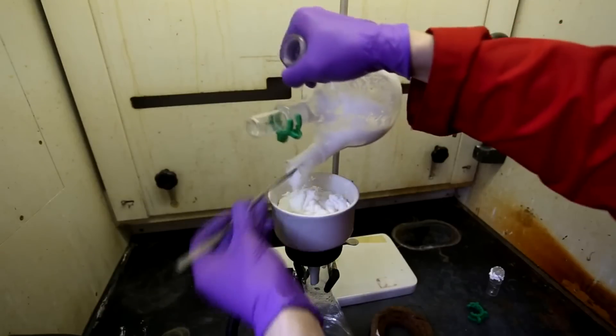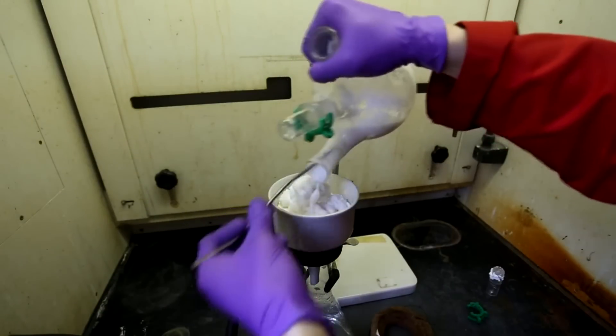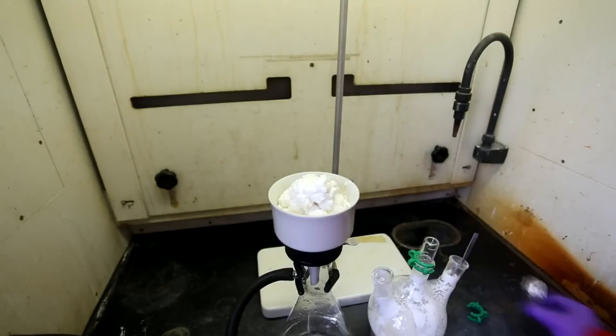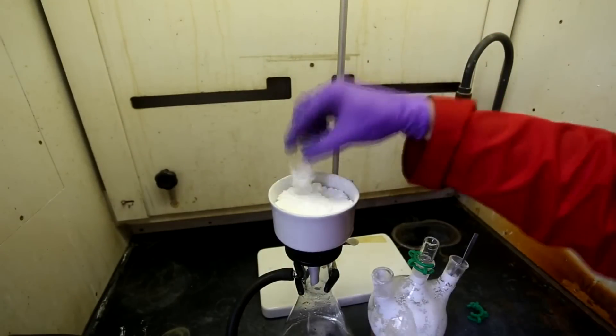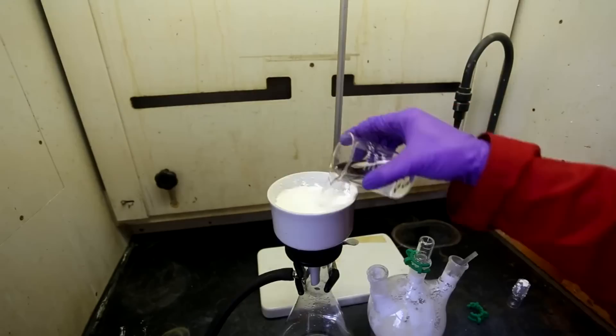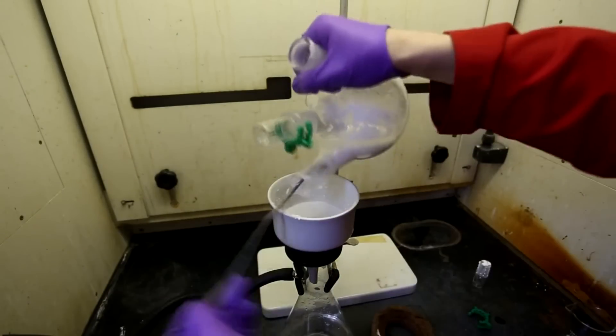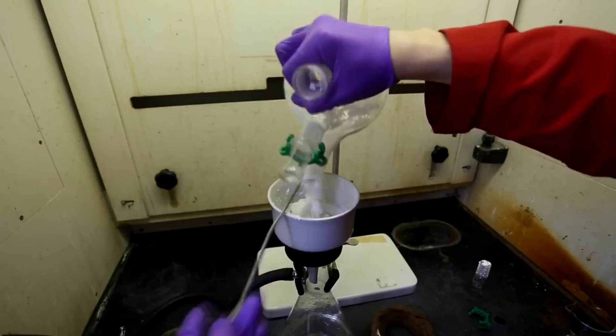However, I don't think this was nearly enough and I highly suggest washing with a lot more water, say like 300 milliliters or even more. It is important to wash with a lot of water because you want to remove as much hydrochloric acid, as much salt, and as much acetic acid as possible. Salicylic acid is almost insoluble in water so the loss should be minimal.